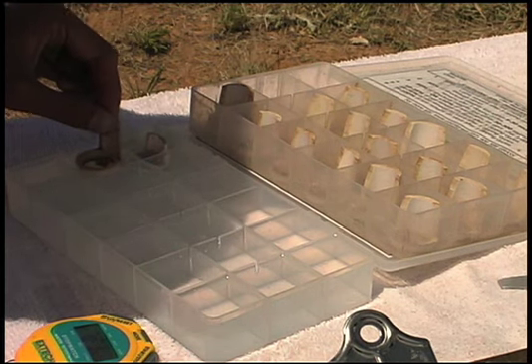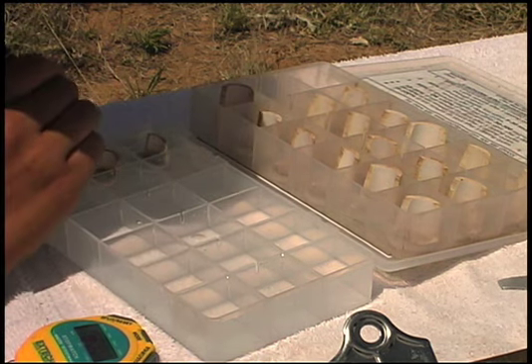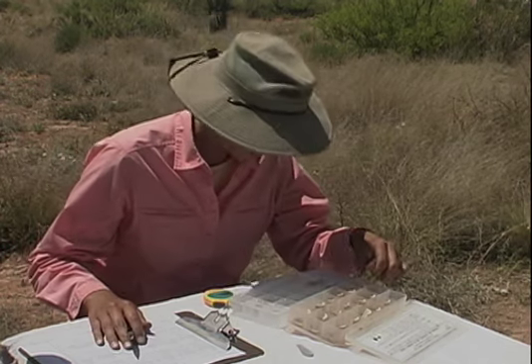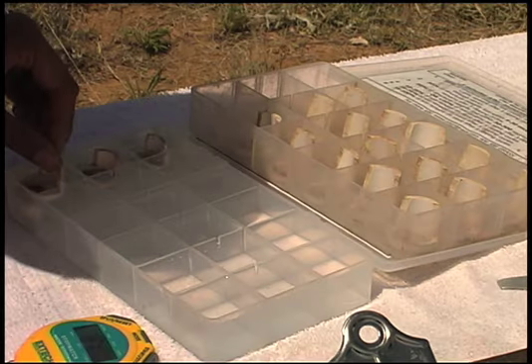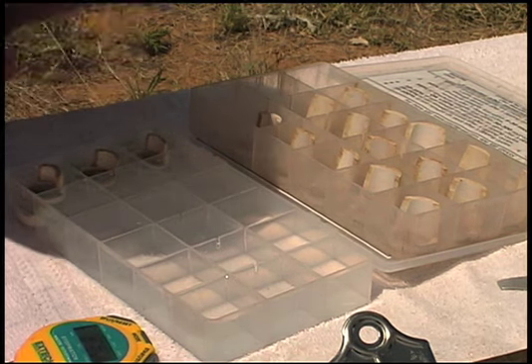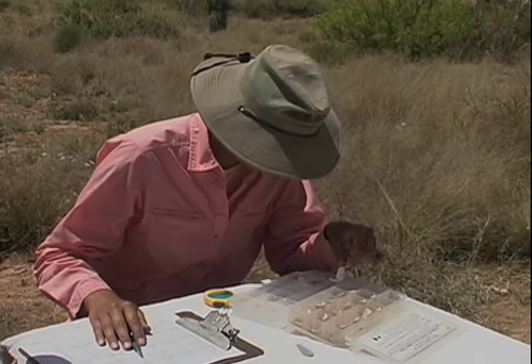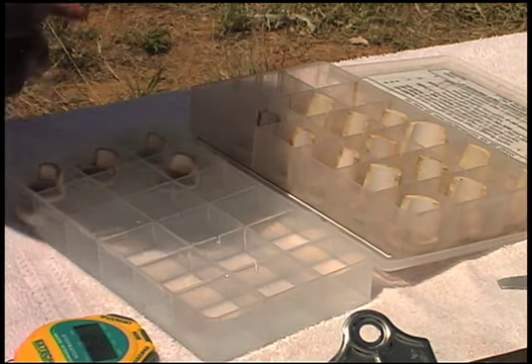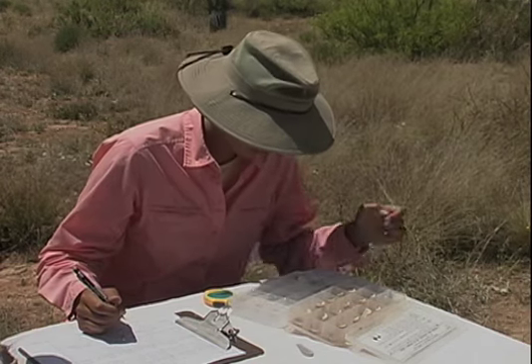At 15 seconds, put the second sample in. If it sticks to the side, gently push it away. At 30 seconds, put the third sample in. Continue to watch the second sample. Follow the sequence of immersions on the data form, adding 1 sample every 15 seconds. When you add a sample into a cell, remember to watch the previous 2 samples for a rating of 2 because you are still within the 30-second time window.